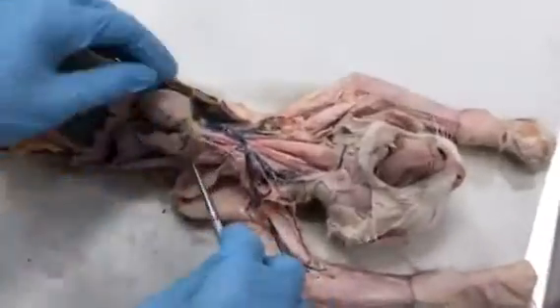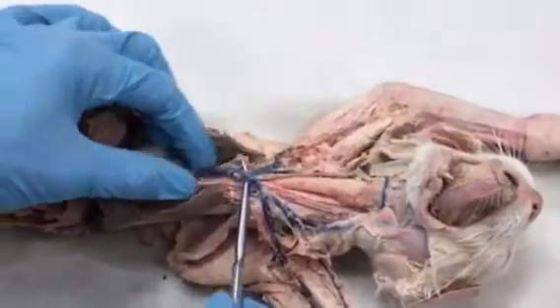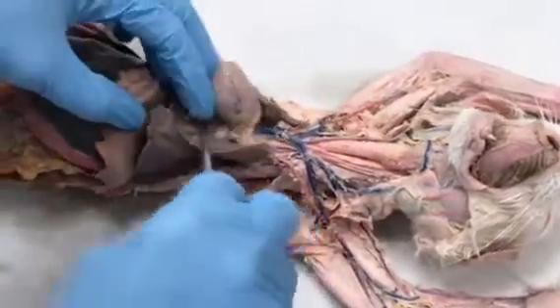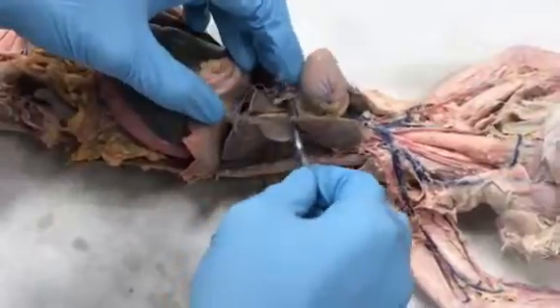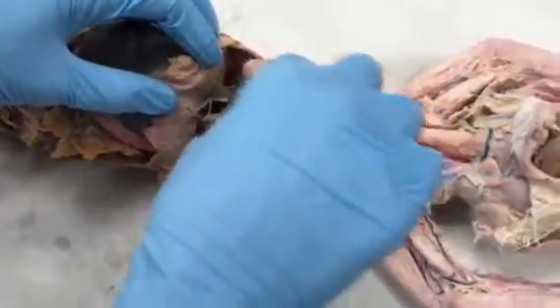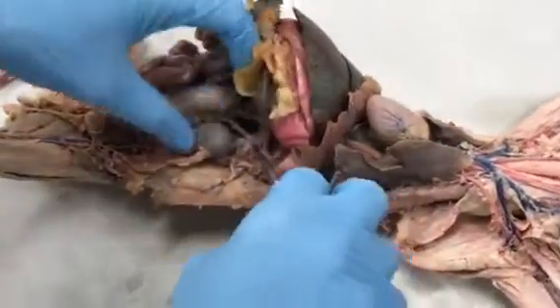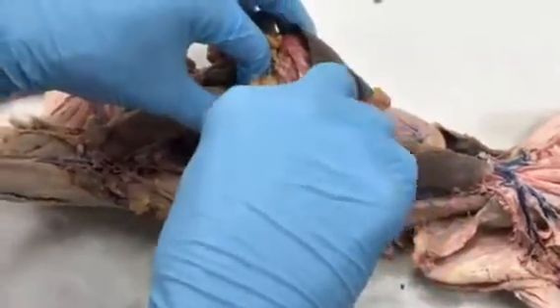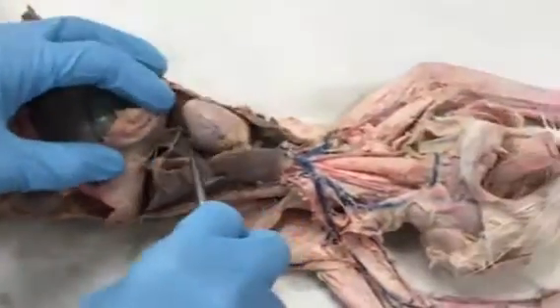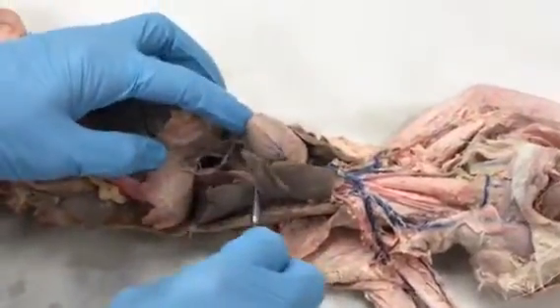So for the veins, we start from the heart again. We have the precava, which services the thoracic cavity, and also the postcava, which starts from the heart, goes posterior, still in the thoracic cavity, and then goes through the diaphragm and continues on as the postcava in the abdominal cavity as well. So here, the landmark that divides the pre and postcava is not the diaphragm, it's the heart itself.